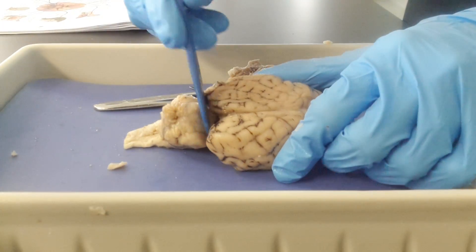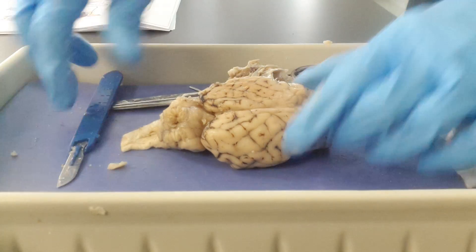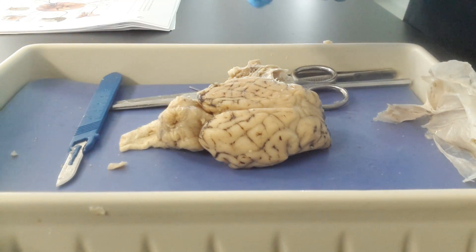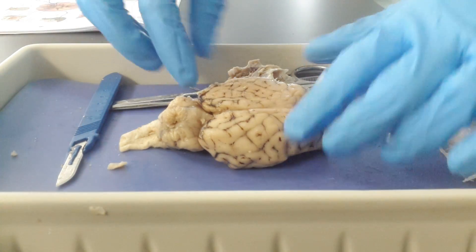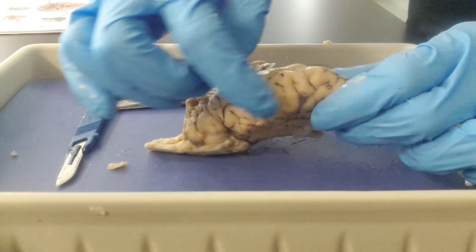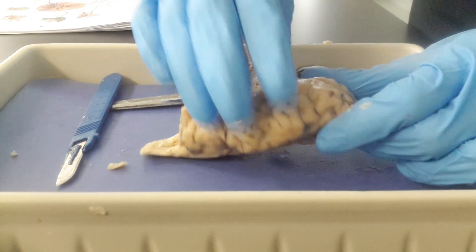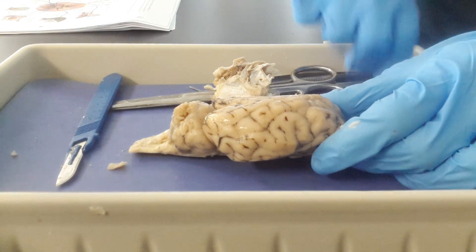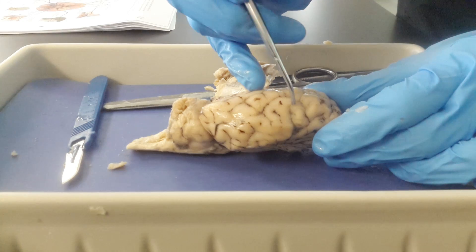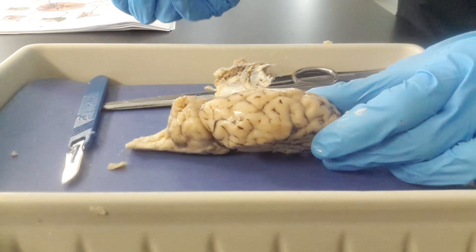This fissure back here is the transverse fissure and that separates the cerebrum from the cerebellum. We also see lots of little grooves and folds throughout the cerebrum, and that's to increase the surface area of the cerebrum so that we can have a maximal number of neurons present. The raised portions are gyri and these little grooves are sulci.